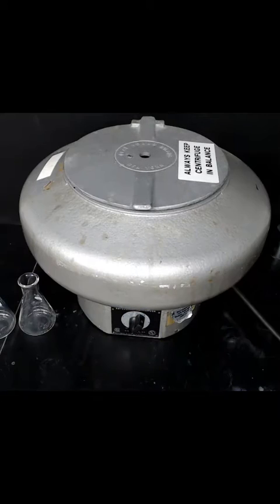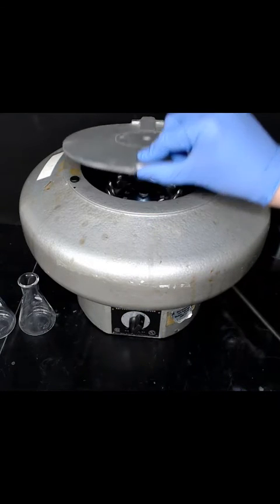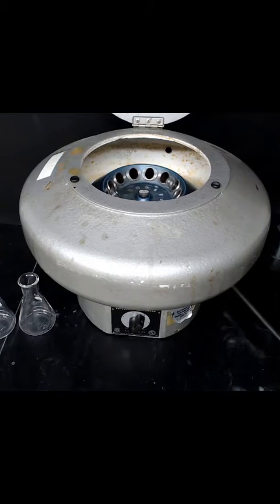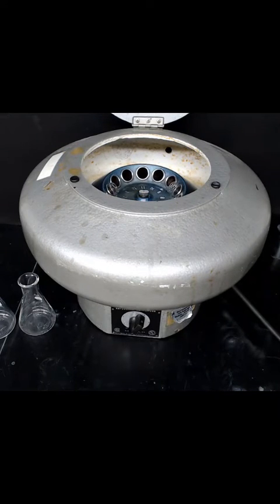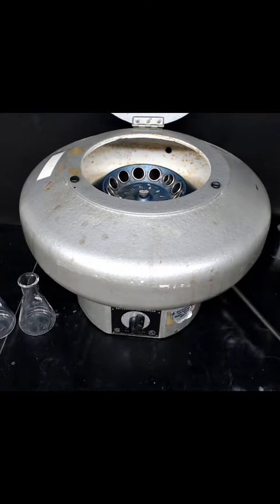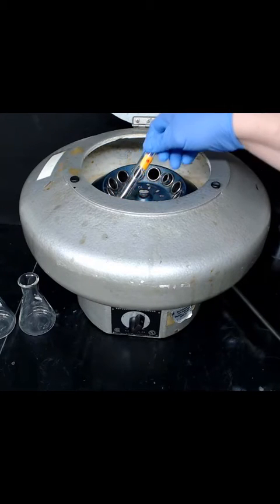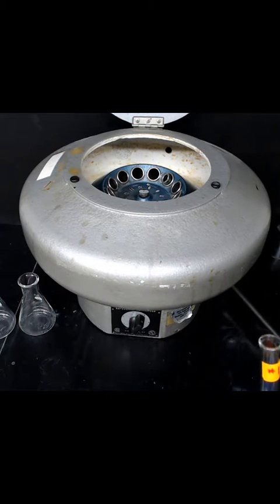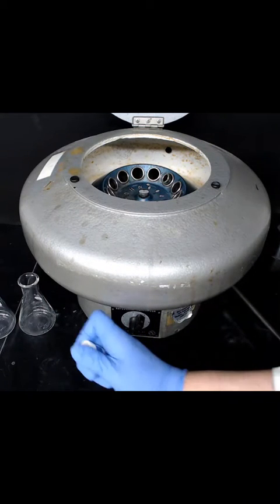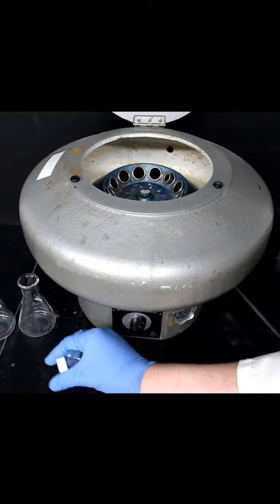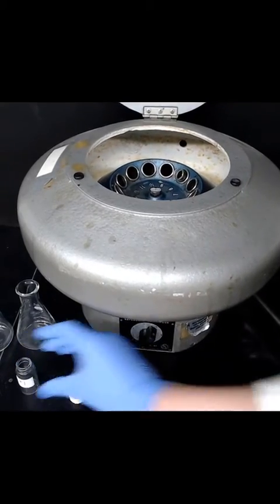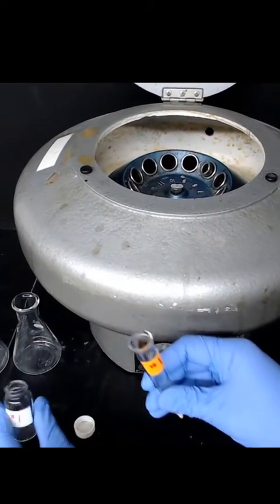We'll turn it down. It's important to leave the centrifuge door shut when the rotor is spinning and make sure it's completely stopped before we open it. In the centrifuge, the precipitate gets pushed into the tip of the point-bottom test tubes and forms a pellet. Now it's easy to just pour off the supernatant, which is a clear solution of the products dissolved in acetone.